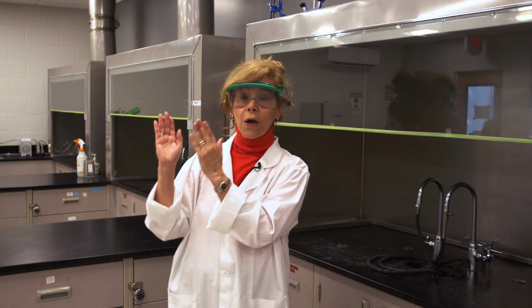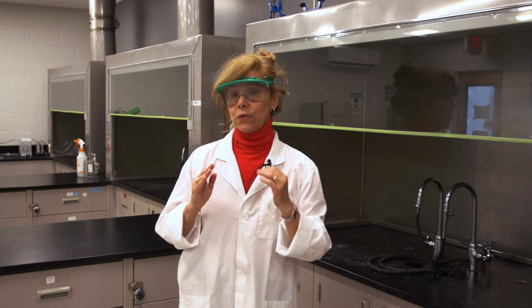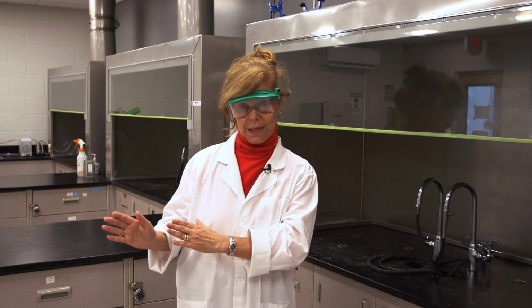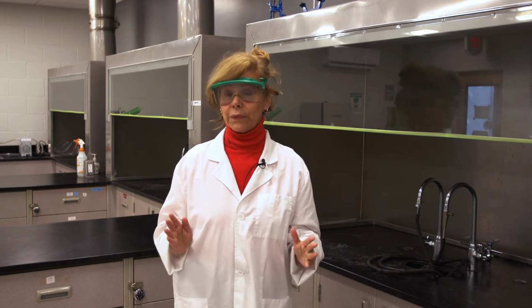And they might be even more specific. For example, this is for this particular type of solvent, this particular waste. So you need to take time to read about the solvents that you're using, the labels of the things that you're using, and the labels of the lab waste. And always, if in doubt, ask your instructor how to dispose of the particular waste.